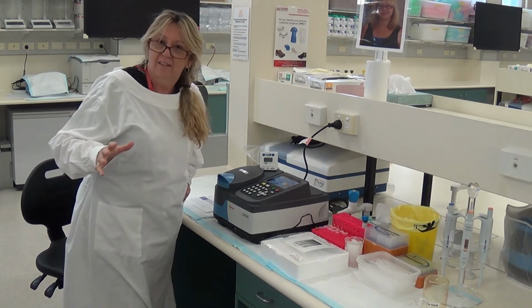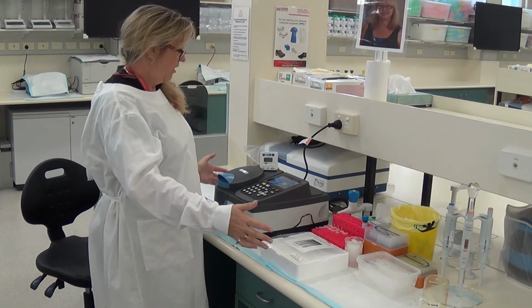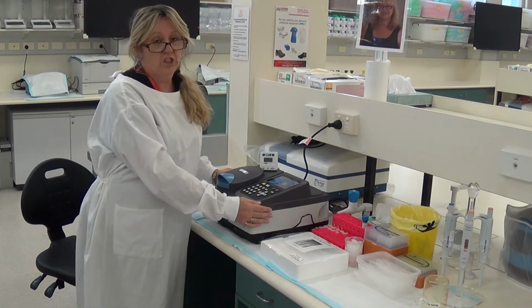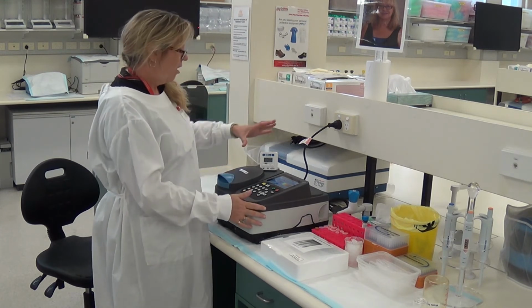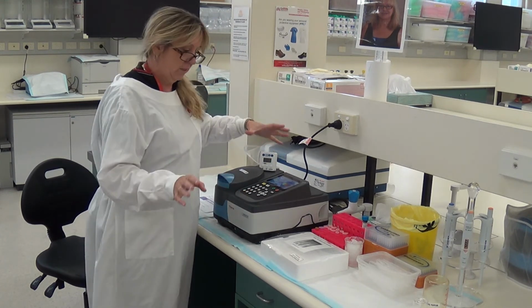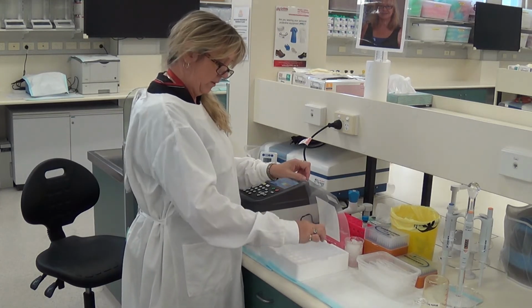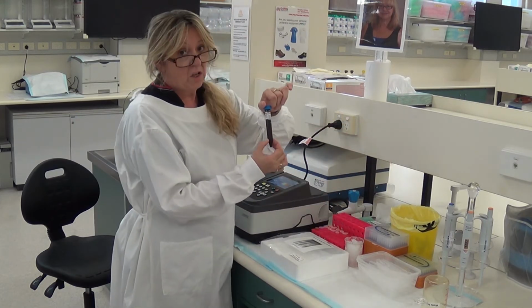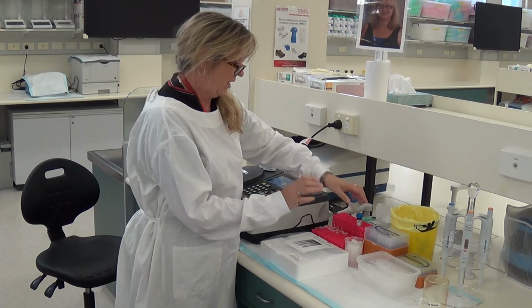Okay, so let's begin. You're going to walk into the laboratory, and here is our setup for our lab. So you can see our spec machine. We've been through that before. We're going to check that it's on 340 nanometers, and I'll show you a close-up of that shortly. I have a timer, which is really important for this lecture. We have our cuvettes, and these are 1 ml cuvettes. We have NAD plus solution. So this is light sensitive. That's why it's in this brown colour, so that it can't get light to it, otherwise it's deactivated.